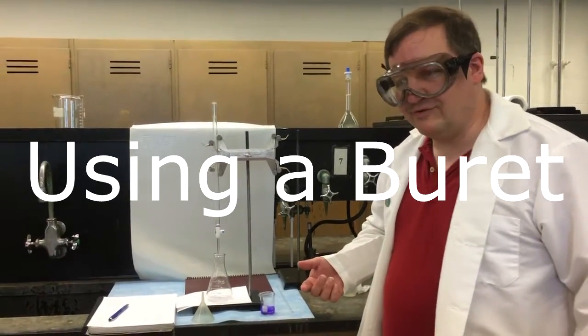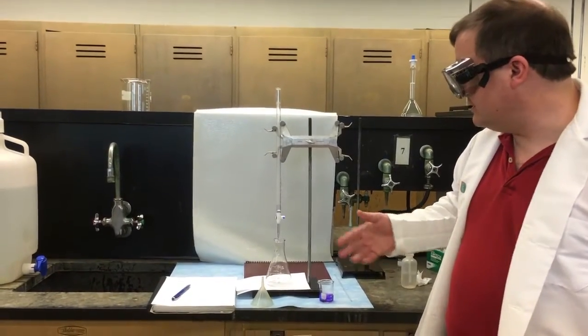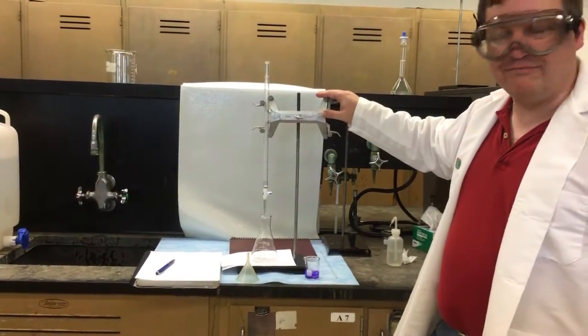Okay, so now we're going to talk about the use of a burette. You can see a burette is used quite a bit in chemistry. It's set up here on a stand. It's a burette clamp. We keep them in the lab.